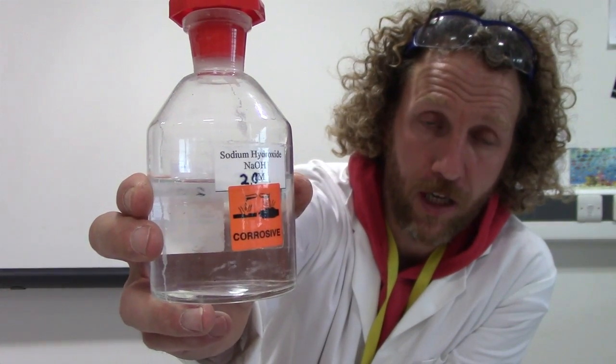Today we're going to specifically be neutralizing an acid with an alkali and we're going to be using the following things. We're going to be using an acid — I've got two molar hydrochloric acid, that's an irritant but it's still pretty strong, so you have to mop up any spills or if you get any on your hands, rinse under the tap straight away. We're also going to be neutralizing that with an alkali — I've got a pretty strong one here, hence the corrosive label — it's two molar sodium hydroxide. You may or may not be using one that strong.